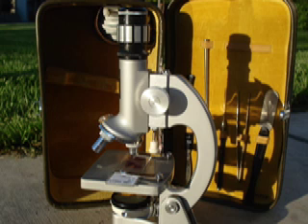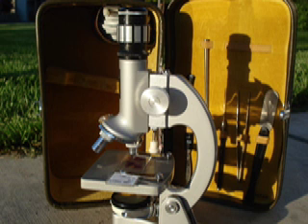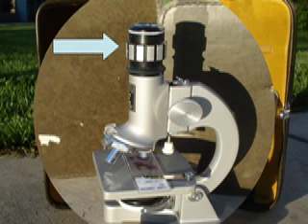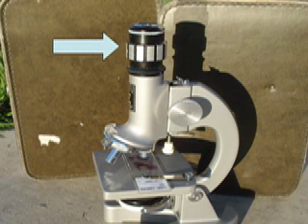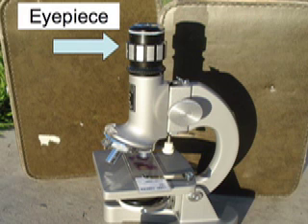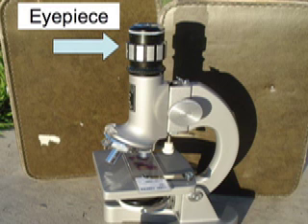The compound light microscope is a very useful tool for biologists. Very soon we will be using these in class, but first let's learn some important parts. The first part we're going to look at is called the eyepiece — it's the part that we use when we first examine the specimen. The eyepiece has a magnification of 10x.